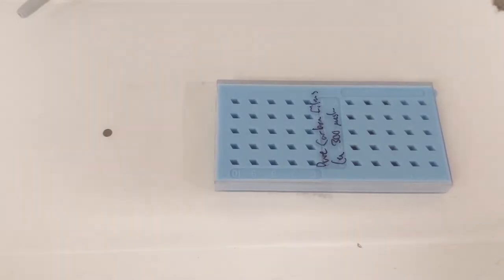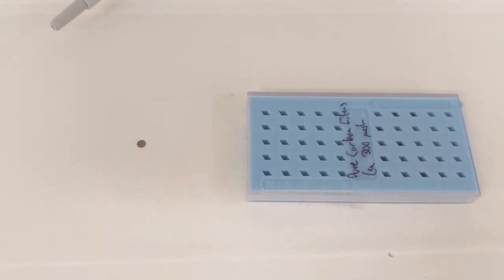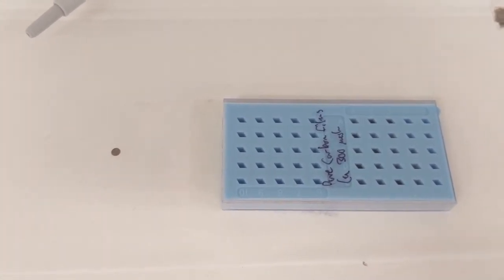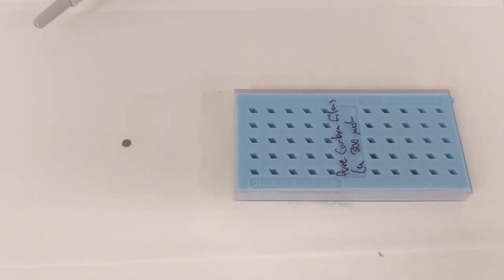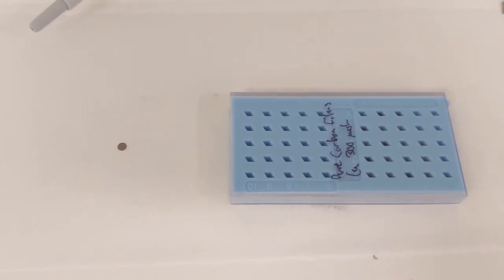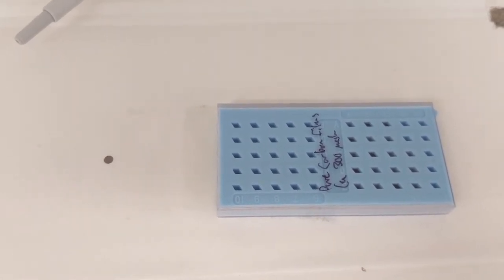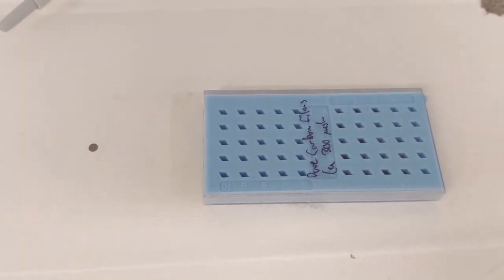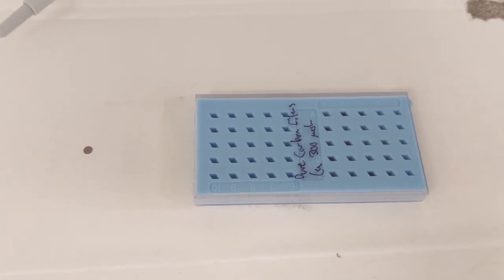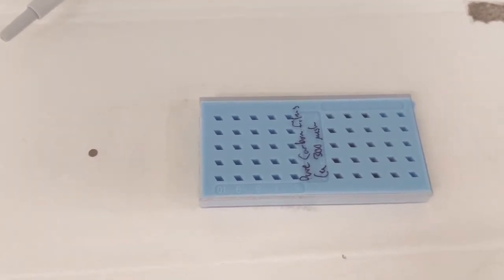So let's take a look at the tools we'll need. This is a TEM grid — a 3mm copper disc with a square array of holes. We can see a magnified image of this on slide 3 of the notes. We use the bars created by those holes to support a thin carbon film which sits over the holes, and we deposit the sample onto that carbon film. When the solution evaporates, we're left with the particles on the film.